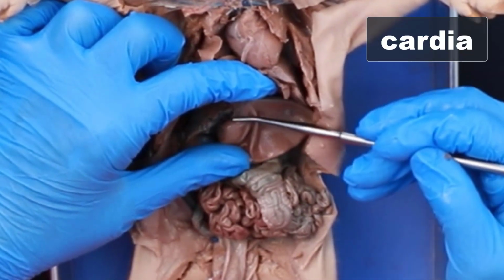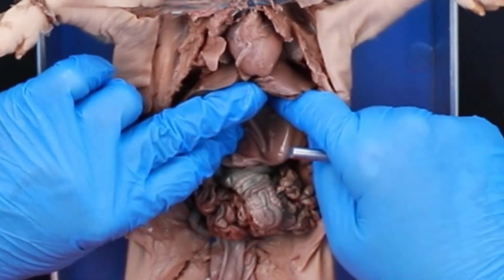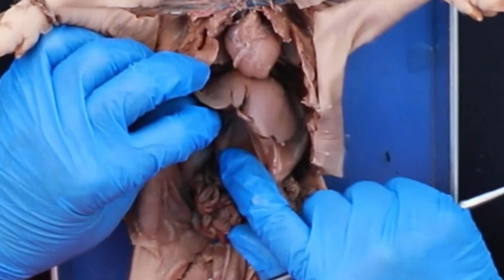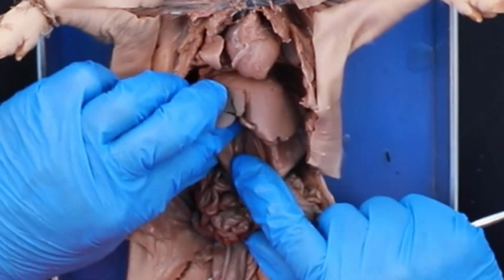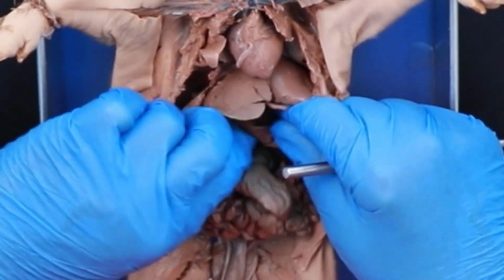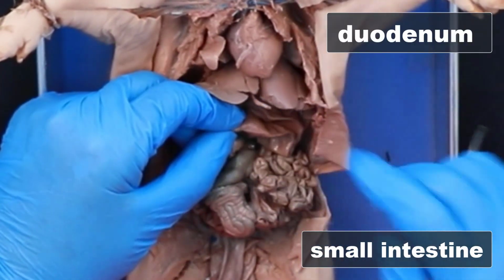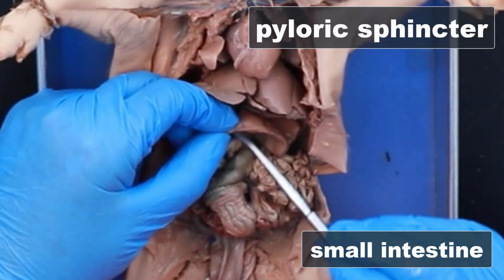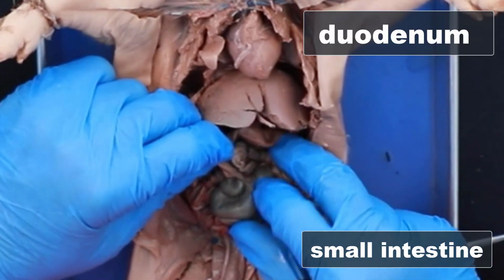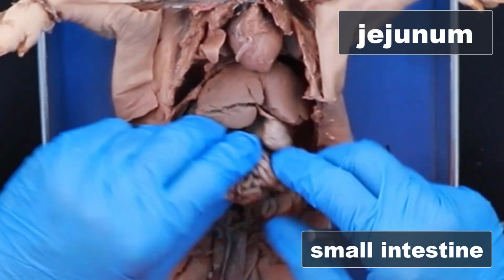And so this is the cardia of the stomach. And then we have the little domed area right here, which is the fundus. And this is the body of the stomach. This is a pretty empty stomach here. Then it goes up into the pylorus and then empties into the first part of the small intestine, which is the duodenum. And there is your pyloric sphincter between the two right there. So this is all duodenum, small intestine, and this is jejunum.